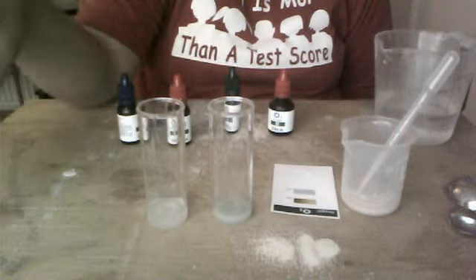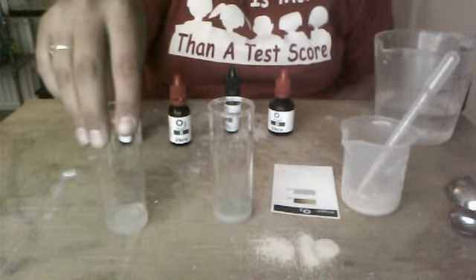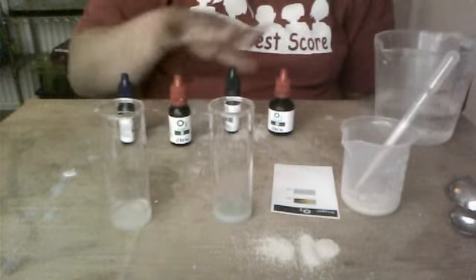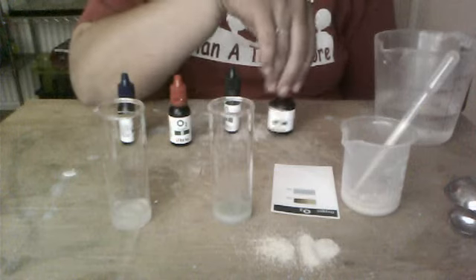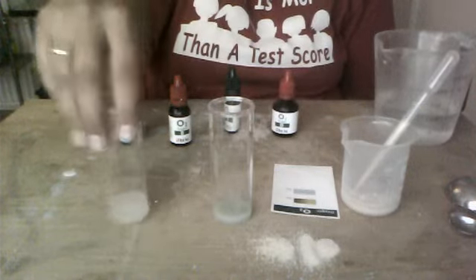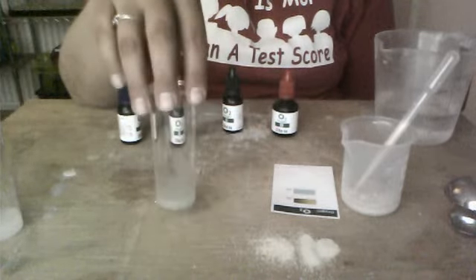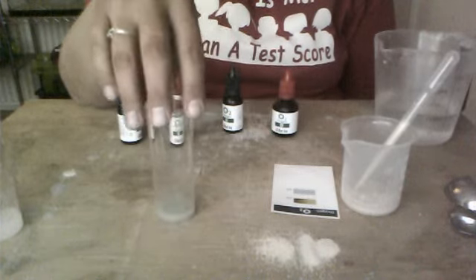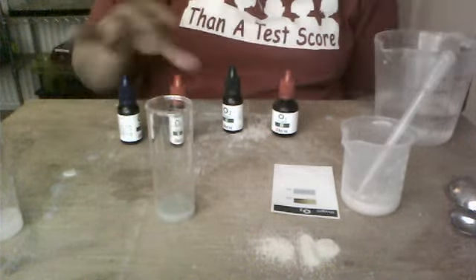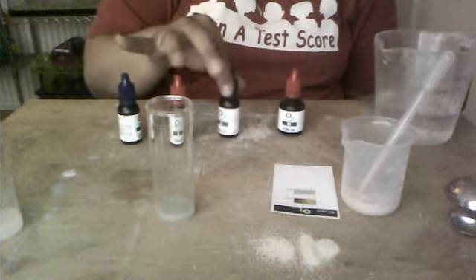That was our control. In phase 2, we had 6 milliliters of water with 10 drops of our yeast solution and all 4 of the reagents, and it only took 3 drops of reagent D to turn this tube blue. And in phase 3, we had 6 milliliters of water and 20 drops of our yeast solution, and we didn't have to go to reagent D. It turned blue after reagent C.